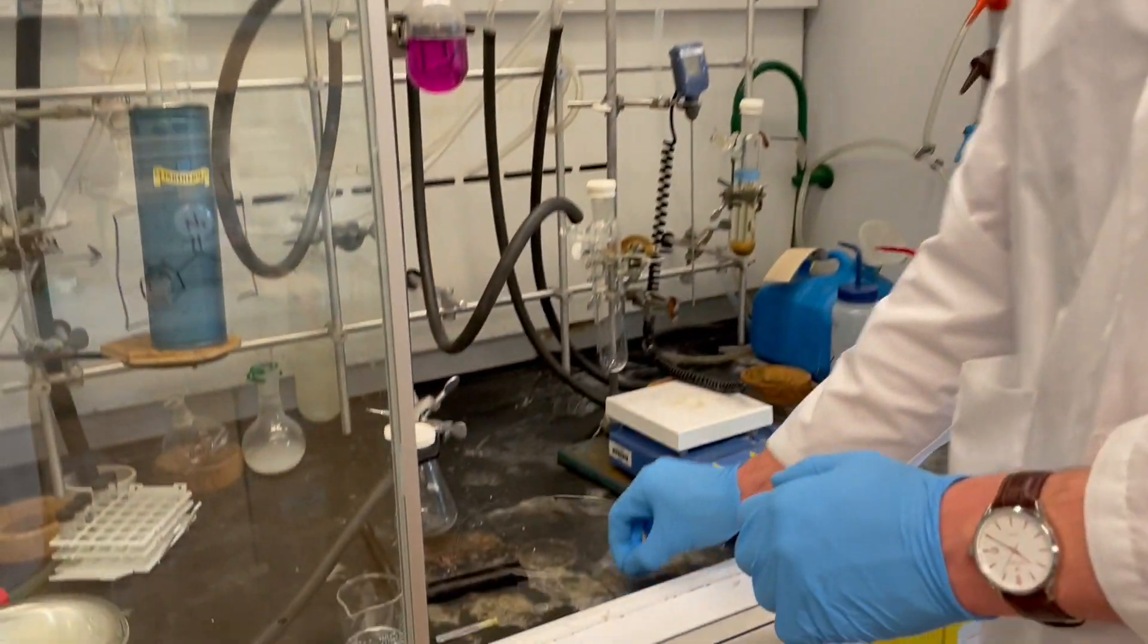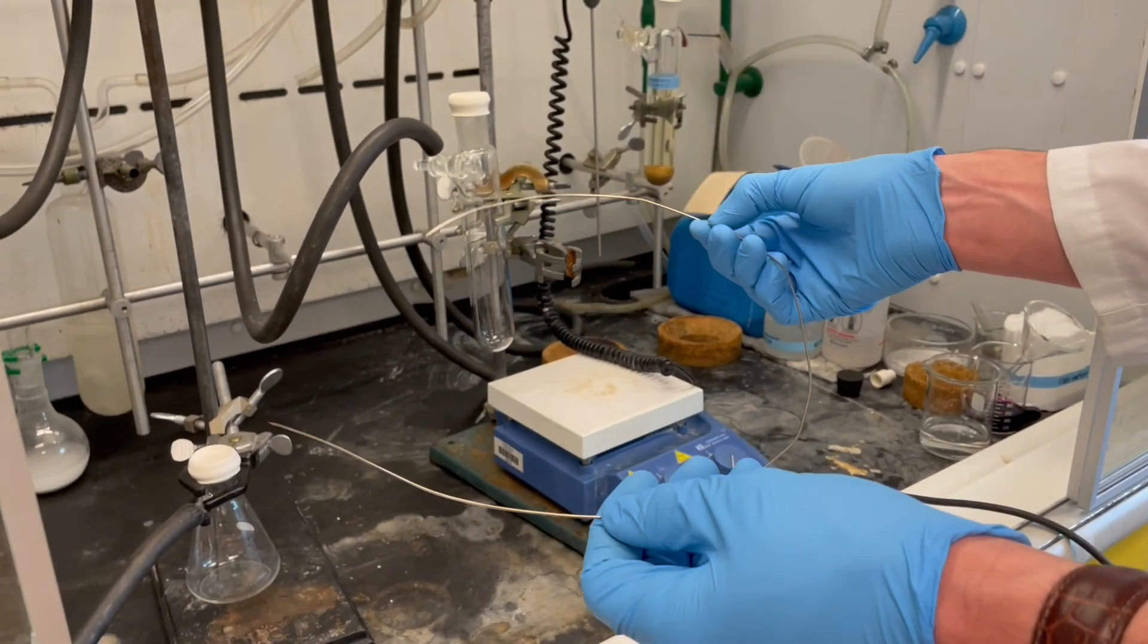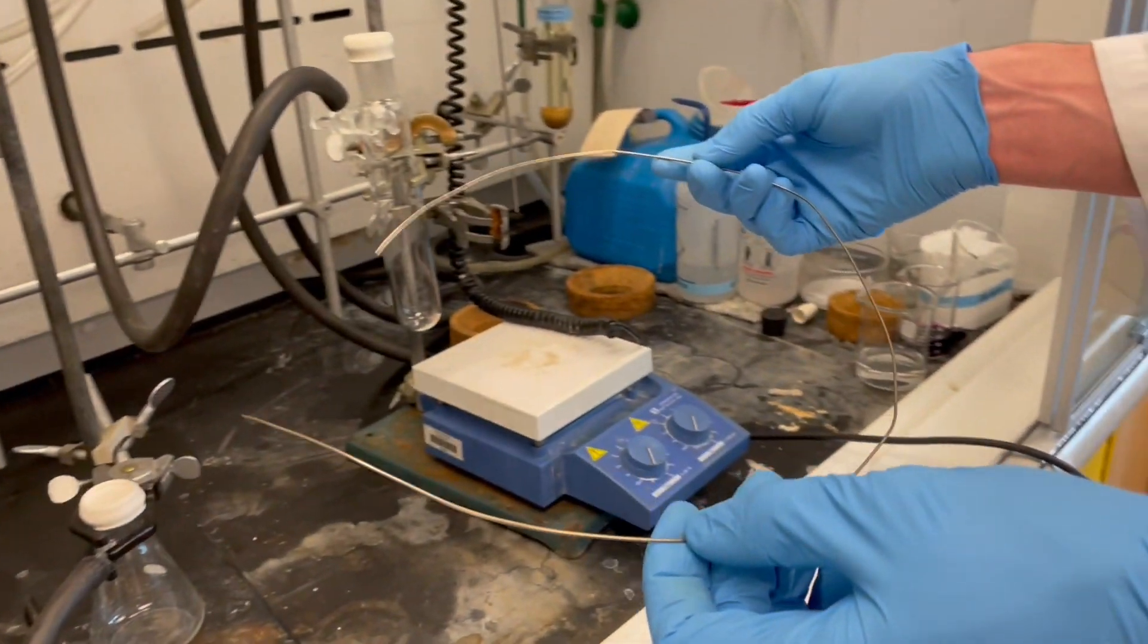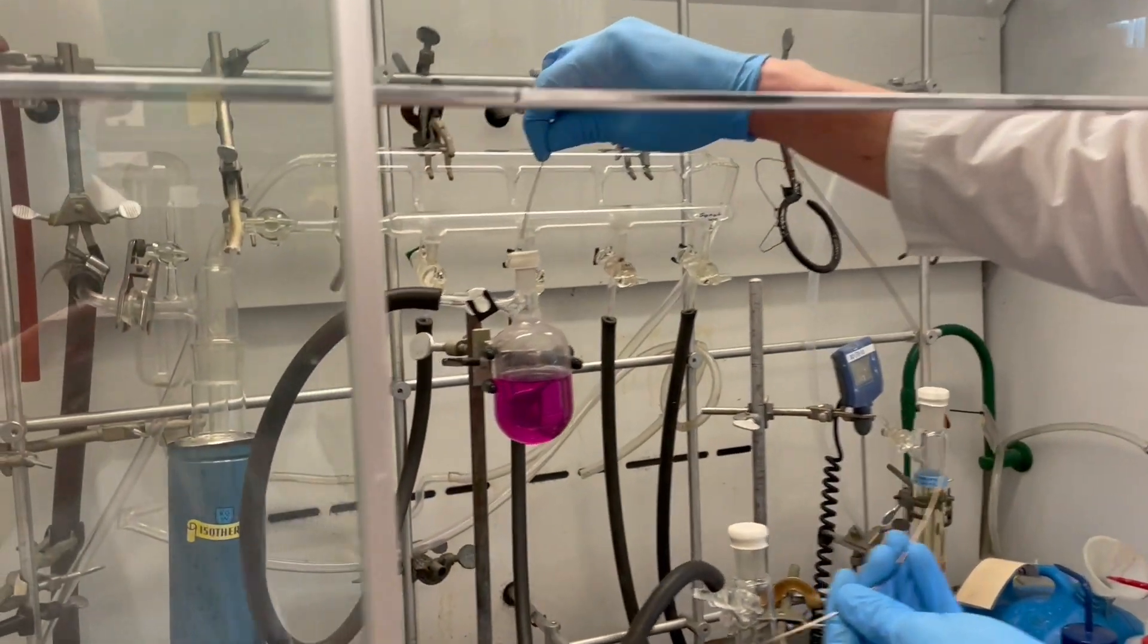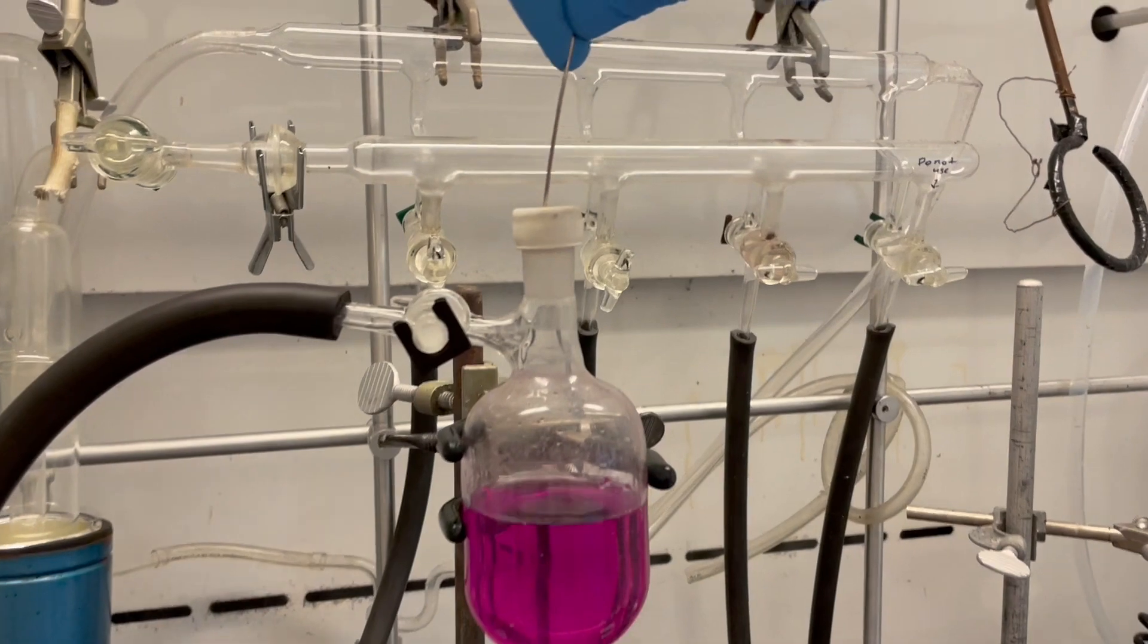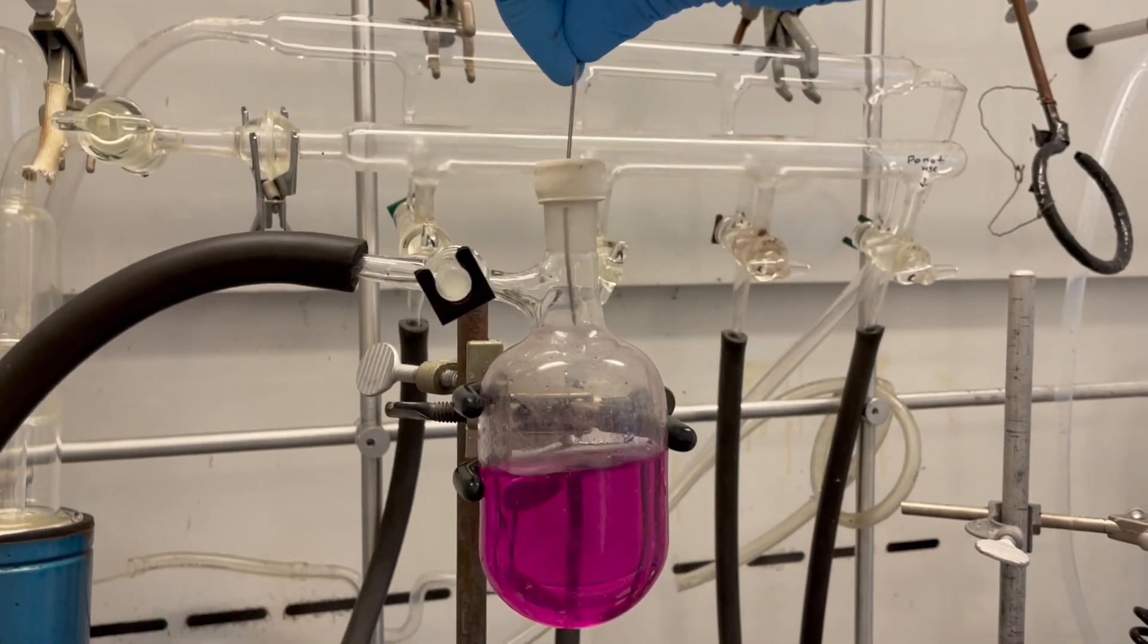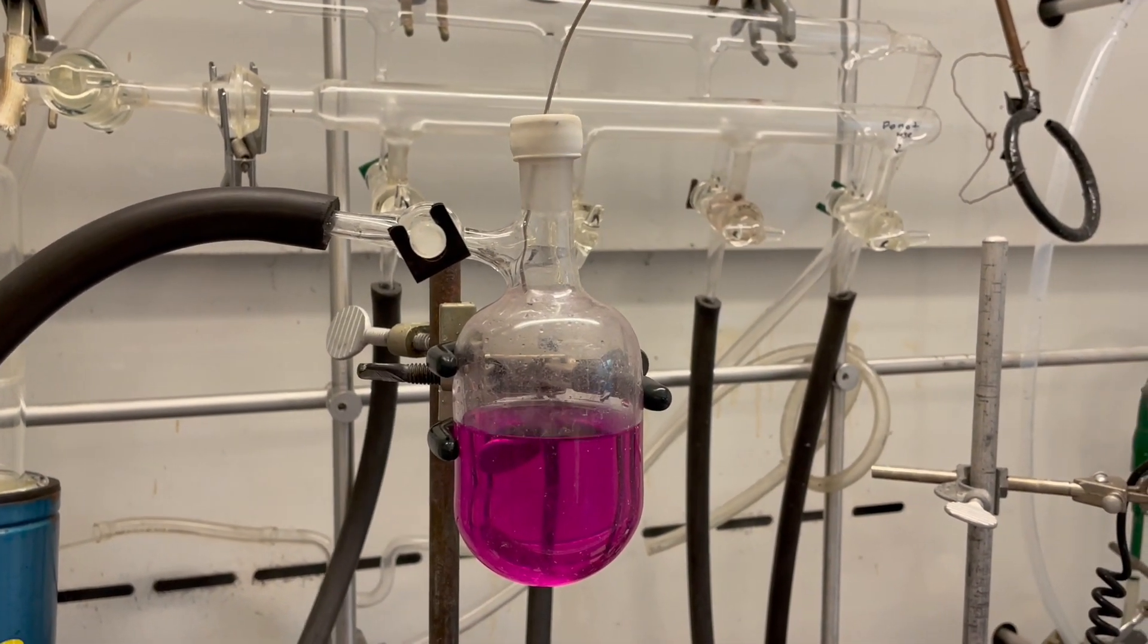First things first, we're going to be using this double-tipped cannula needle, so it's important to be very careful when handling it. I'm going to go ahead and insert the first end into our transfer flask. We don't want to put it all the way into the liquid just yet.